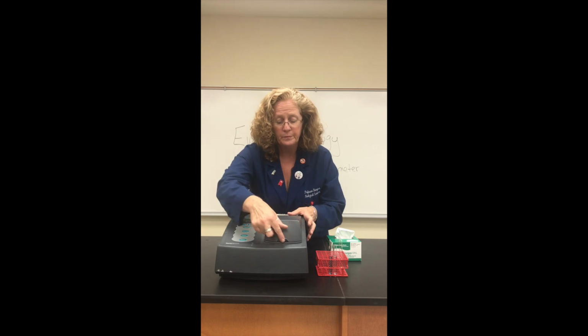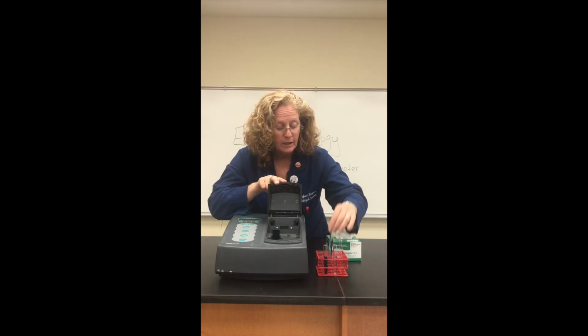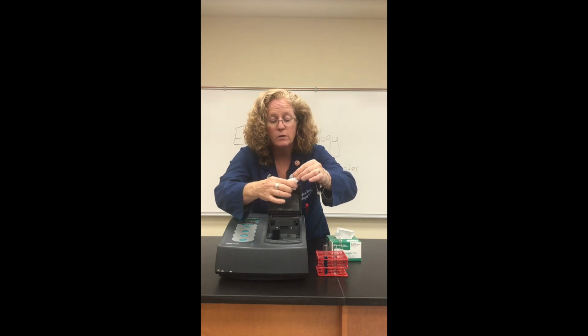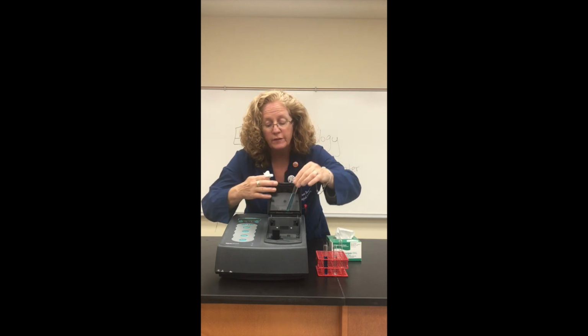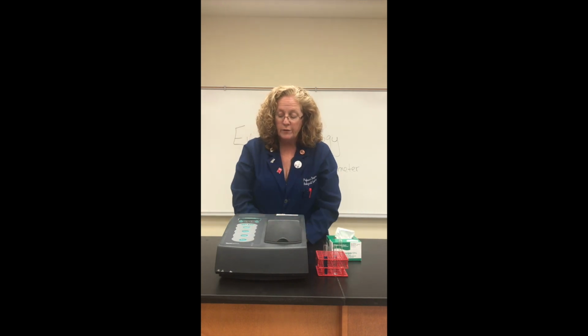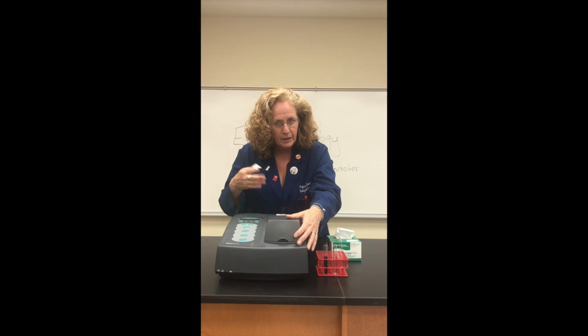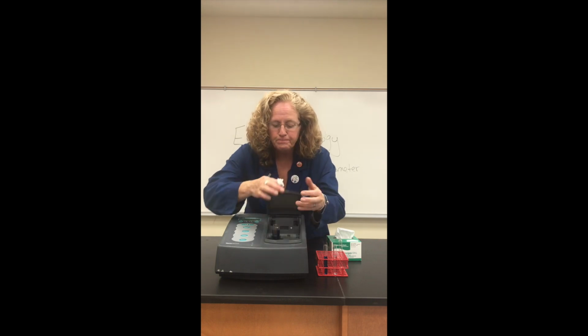I'm going to take this one out. I'm going to put the next one in. Again, wiping the tube down, make sure there's no fingerprints. Close the door and wait for my numbers to settle down. This one has an absorbance reading of 0.042. A little less light being absorbed.